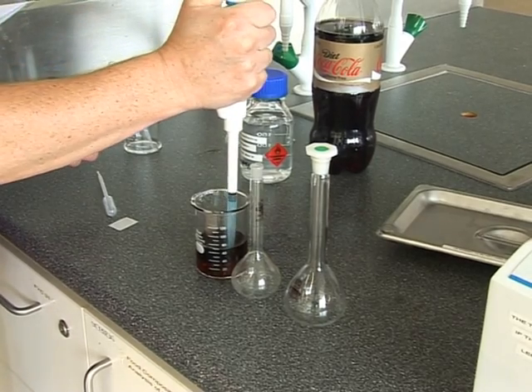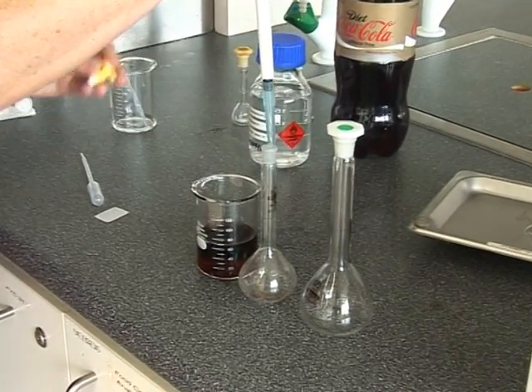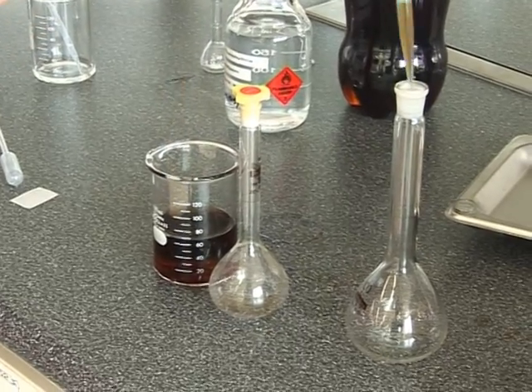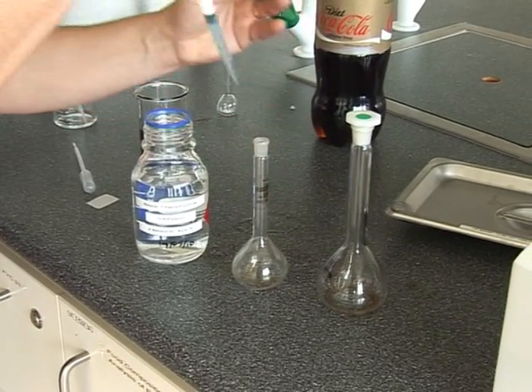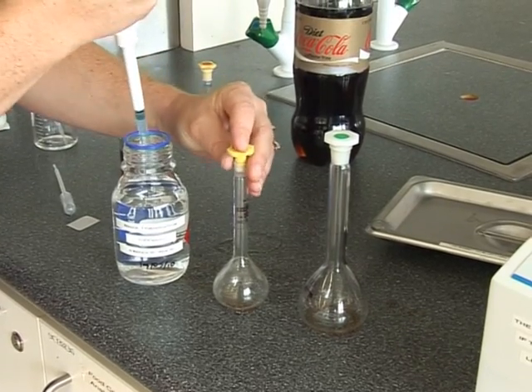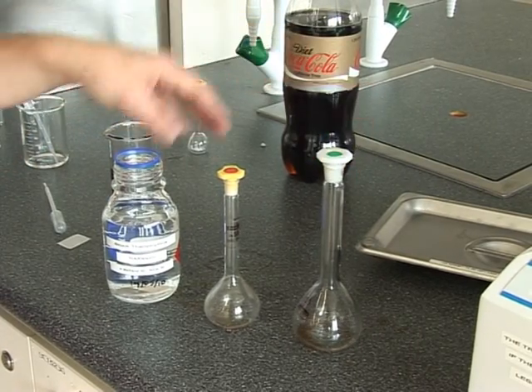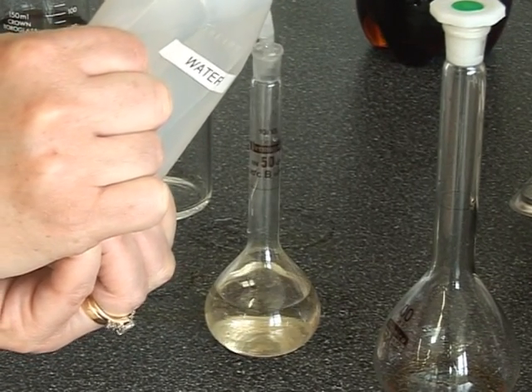You'll need to make a 1 in 50 and a 1 in 100 dilution of each of the soft drinks. Dispense one millilitre of the soft drink into a 50-millilitre volumetric flask and another one millilitre into a 100-millilitre volumetric flask. The samples also require 20 parts per million theophylline in each flask to act as an internal standard. Calculate the amount of the initial theophylline stock solution required to achieve this concentration in the appropriate volumetric flasks. Make the flasks up to the mark using distilled water. Mix well.